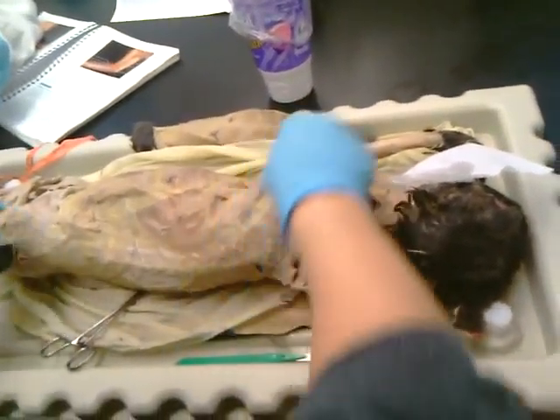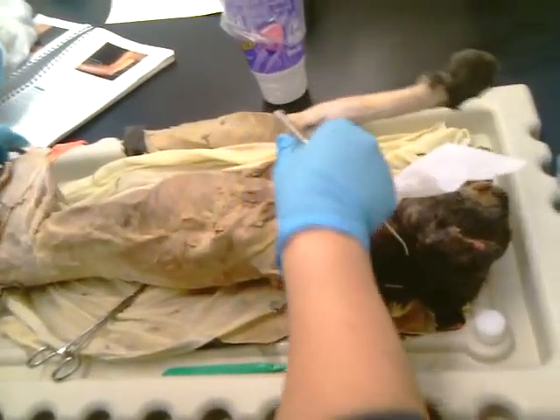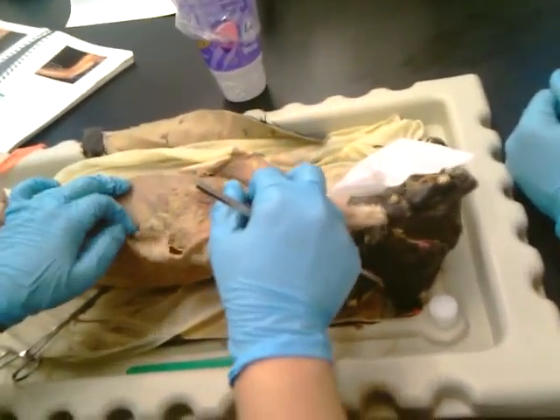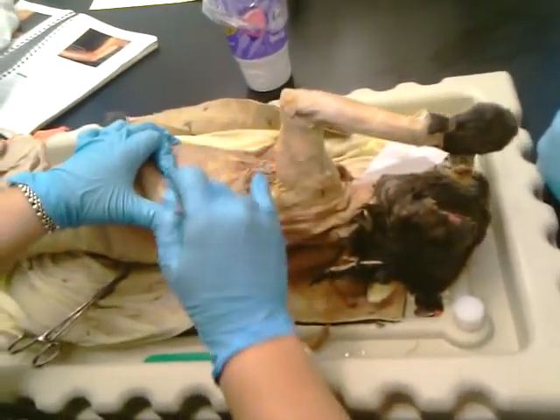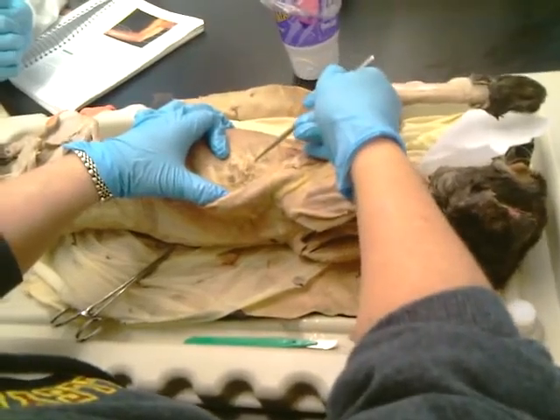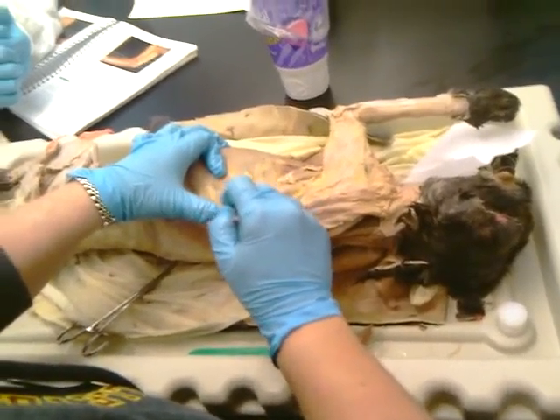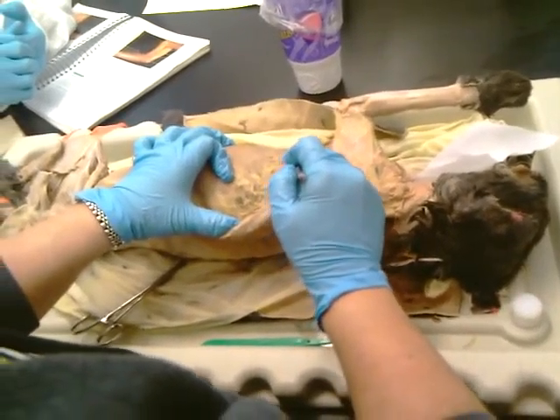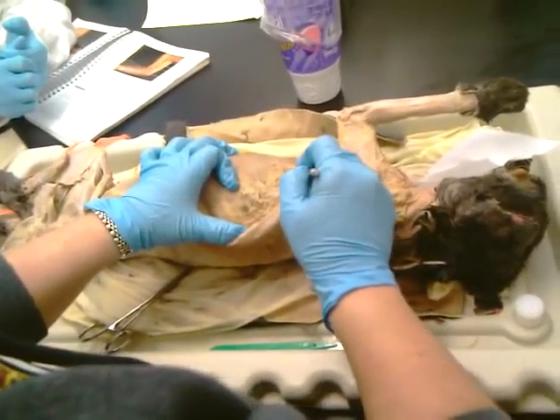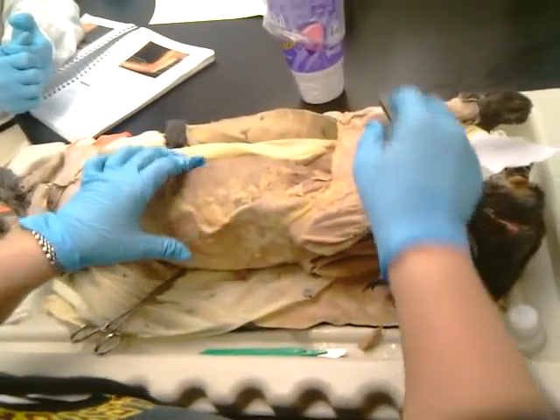Over here, the latissimus dorsi. Okay? That's the lat. And then over here, we're going to have the serratus ventralis muscle. And so I've been able to get underneath the little branches here. So there's a little finger-like projection here, here, there, there. That's the serratus ventralis. Okay, serratus anterior in the human.